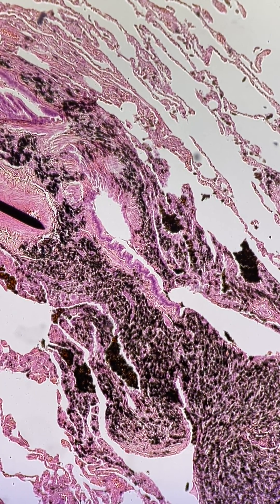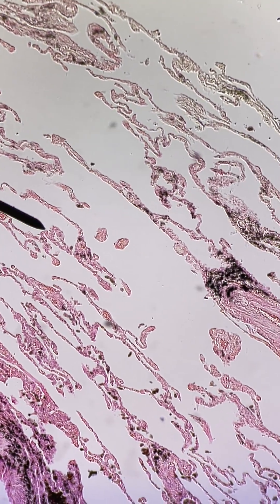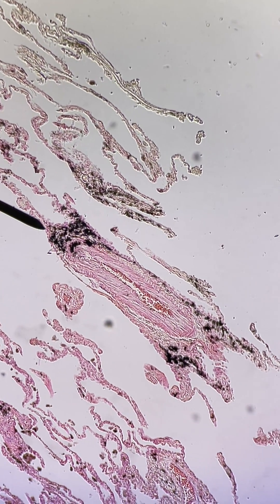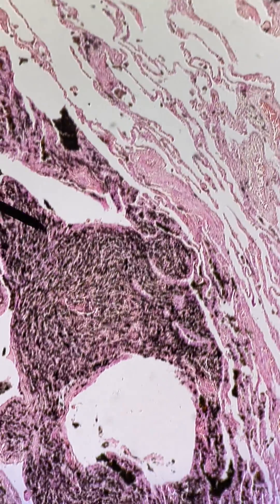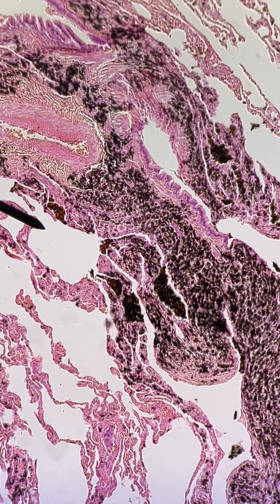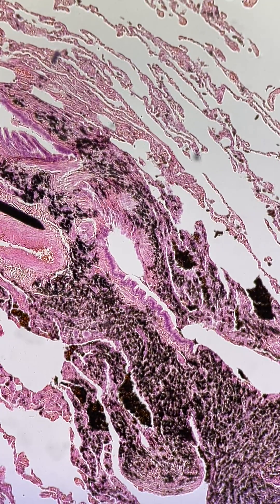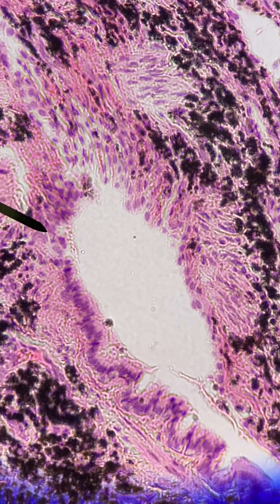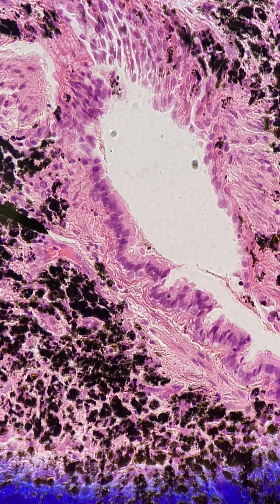This is a lung of a smoker at medium power, 100x total. You can see some alveoli — the cut's not as clean as the normal lung slide — but what you really need to look at are these deposits here. These are carbon particles from the smoke the person was inhaling over their life. That little tube with the pointer is a bronchial, and if I zoom in you can see the same uneven edge we saw on the other lung slide — those are the ciliated pseudostratified columnar epithelium again.